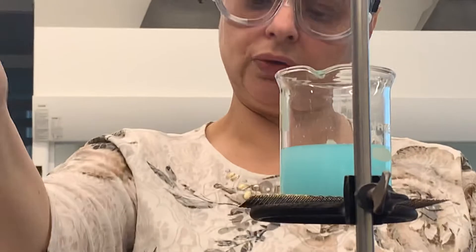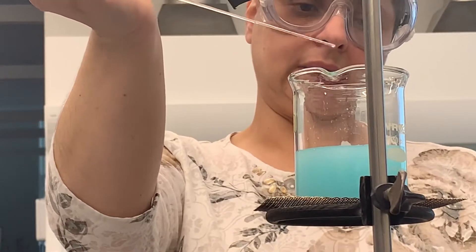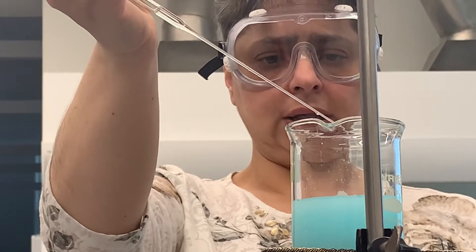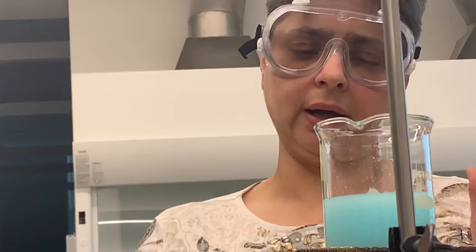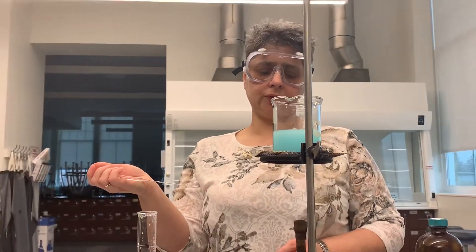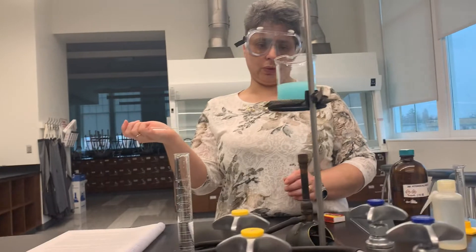This is exactly what you would have been doing in lab. I'm hoping you're learning and understanding what I'm trying to achieve. You'll notice I am adding barium chloride dropwise — a steady stream of drops, not one tiny drop at a time. I'm going to increase the flame a little bit because I want the solution to be gently boiling. Since I scaled down the flame it stopped showing signs of boiling, so I'll heat it up a bit more before adding more barium chloride.